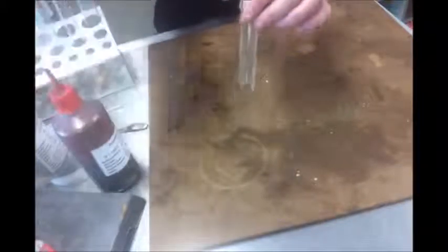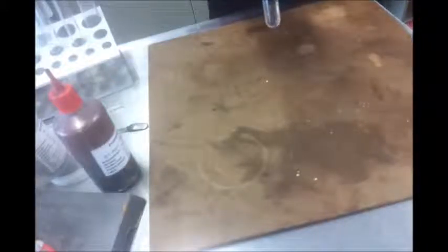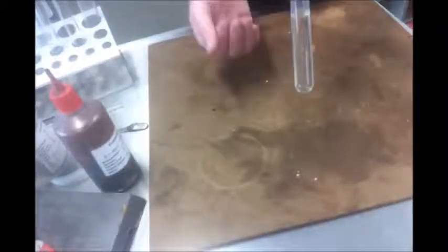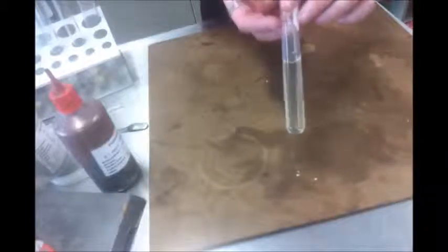So it's taking this permanganate and it's changing it. It's got a chemical reaction. Now if I look at page 56, I see that the thing that is next to permanganate is manganese. Well, actually it probably says manganese 2, which is Mn2+. So I know that permanganate is turning into the colourless manganese 2 ion.